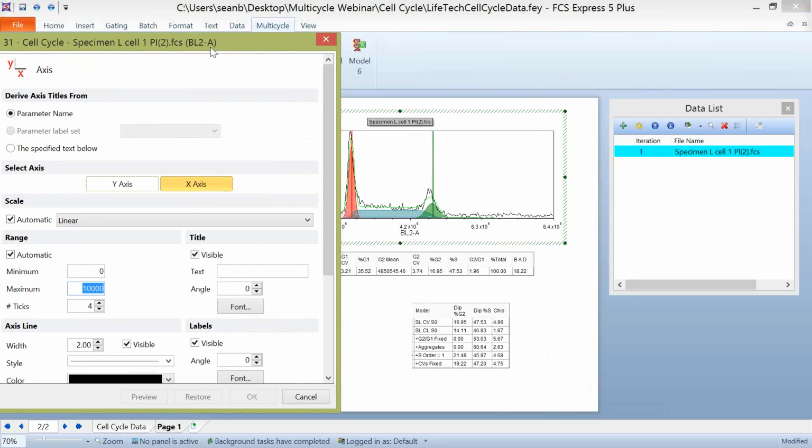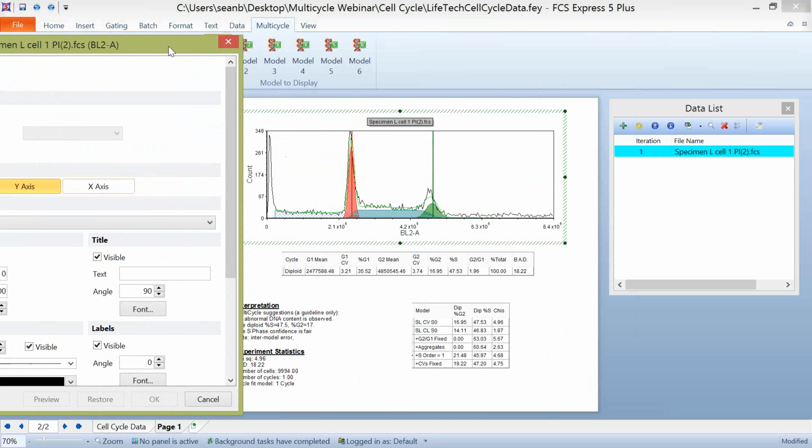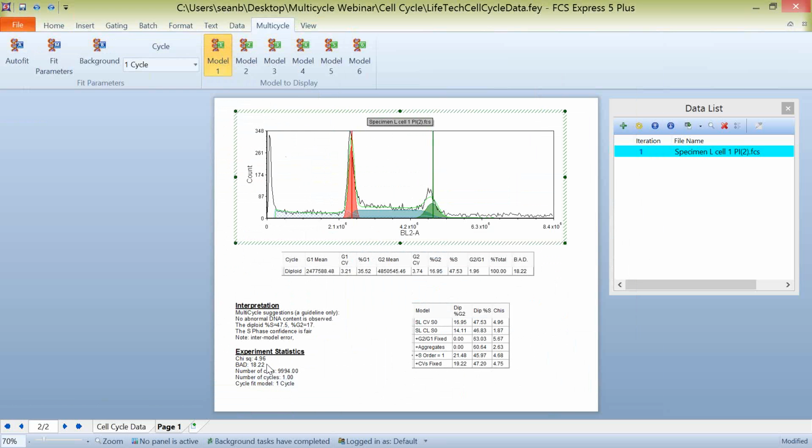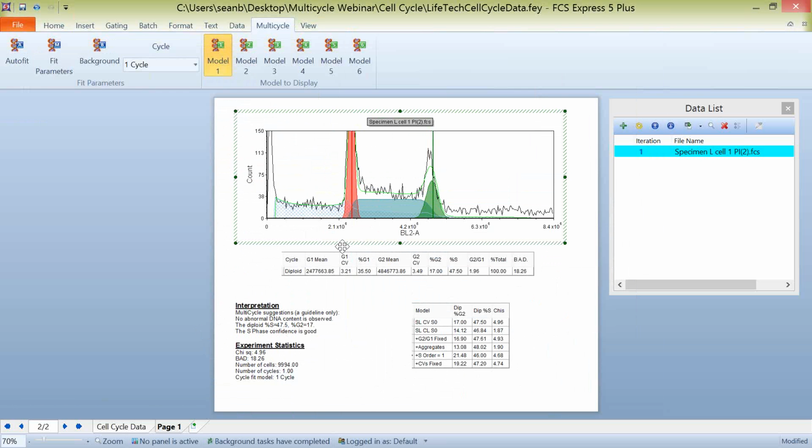You can simply come in here and in your y-axis values, you can change to a new maximum. So if we wanted to zoom in from 0 to 150, we can change that value, and we get a little bit better view now of what's going on behind the scenes, especially here you can see with our background modeling, and if we had other populations that were overlapping, it's a very quick and easy way to do that.